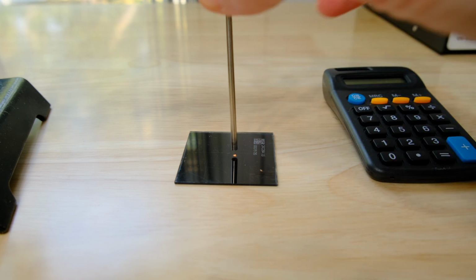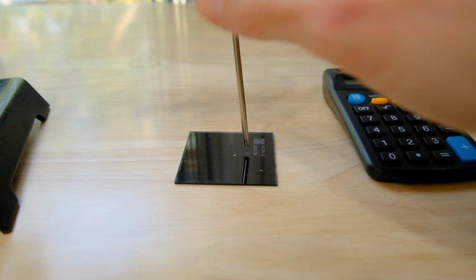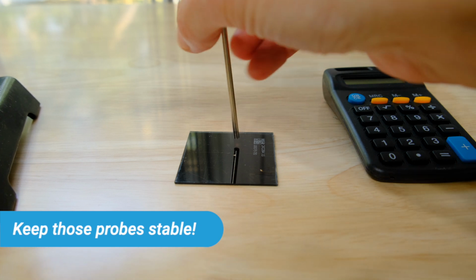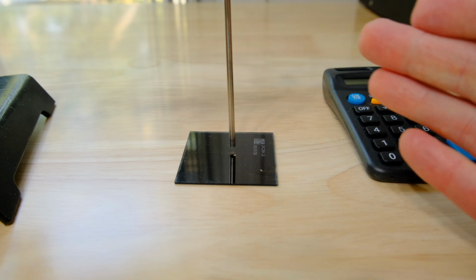But if you have any changes to the angle of the probe or the distance that then carry over to future measurements, that's going to affect your future measurements. So you want to make sure that everything is very tightly fixtured and repeatable when going from measurement to measurement.